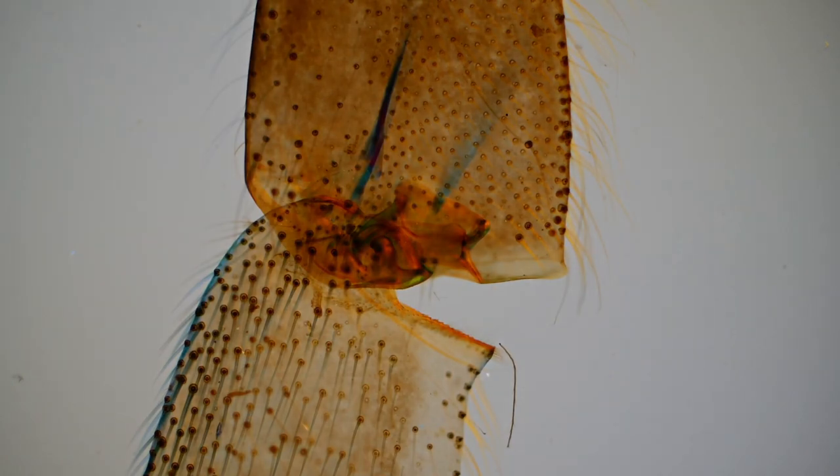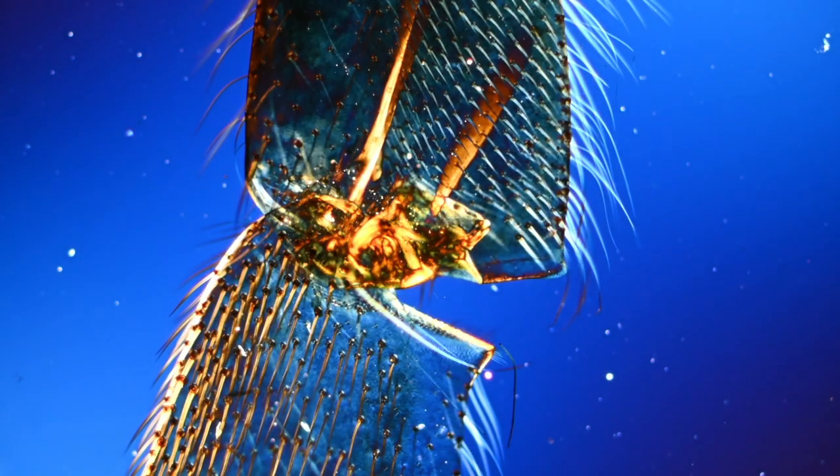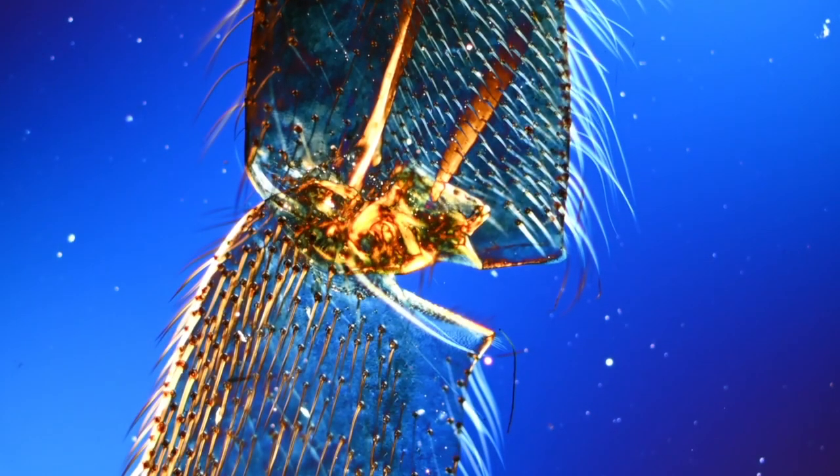So here we go. I can turn this to get the right angle. Look at that. Now you can really see all the individual little hairs that come out of the body, as well as the complex structure of the knee that connects those two pieces together. It's really amazing how much detail there is there.